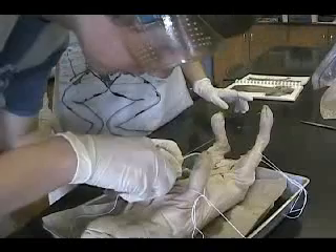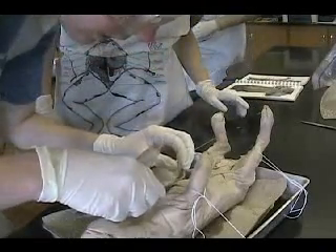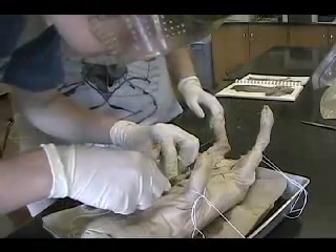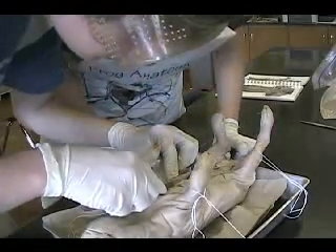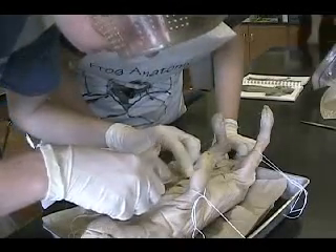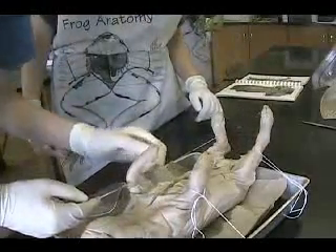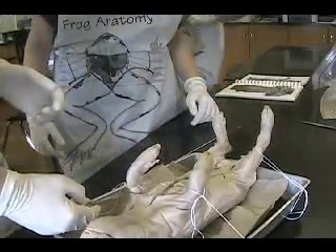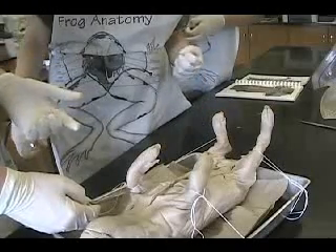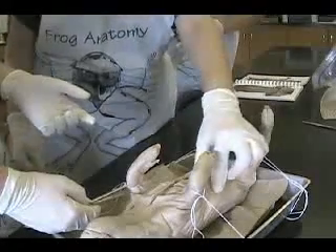You're hitting the bone. I hit the bone. Let's ask her because it is a preserved pig — maybe that's not supposed to be right there. Or maybe I cut too hard? Pull this stuff back.